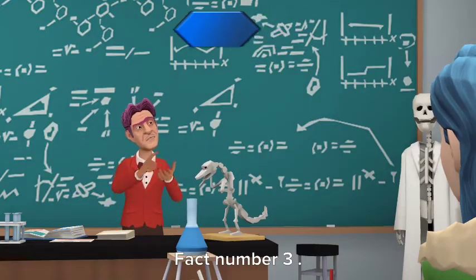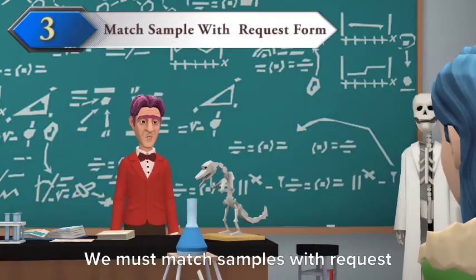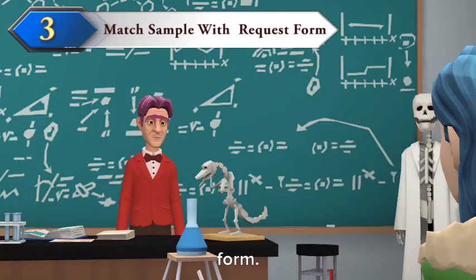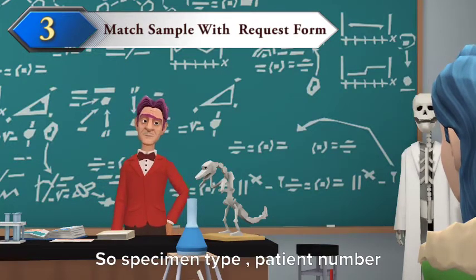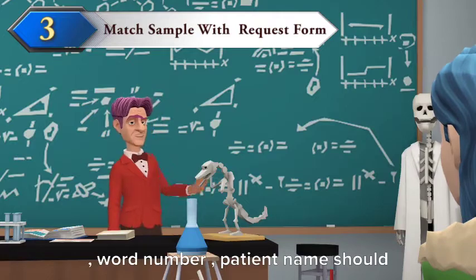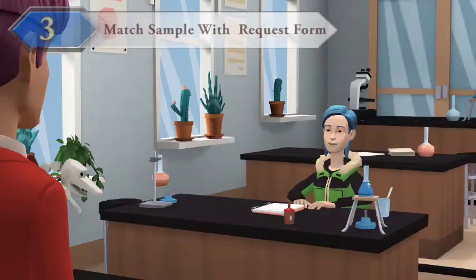Fact number 3: we must match samples with the request form. The specimen type, patient number, ward number, and patient name should all match.